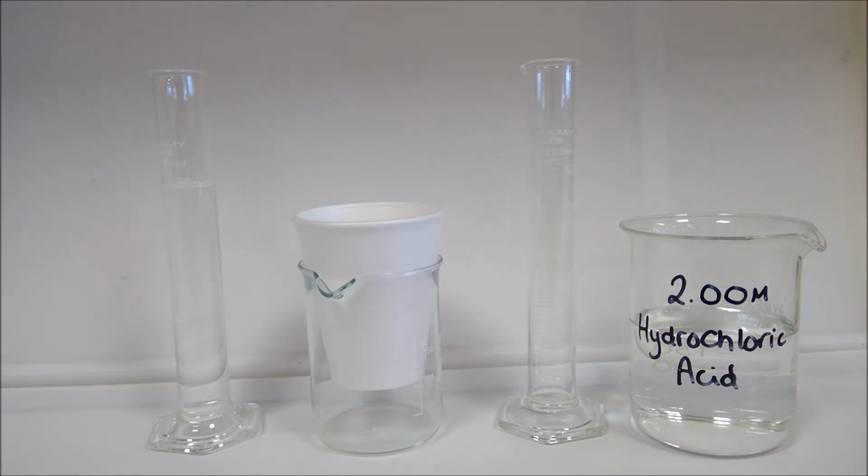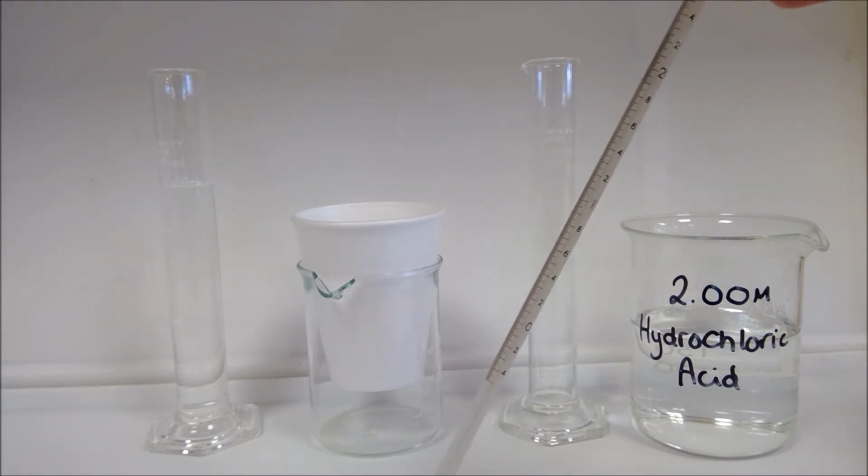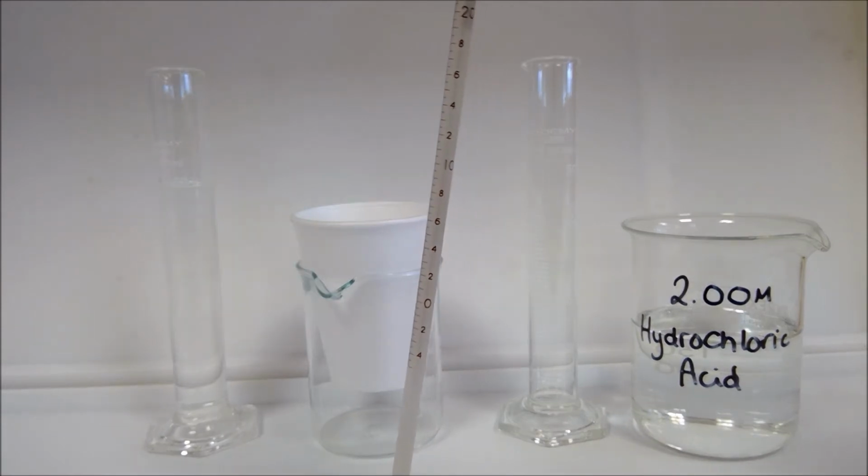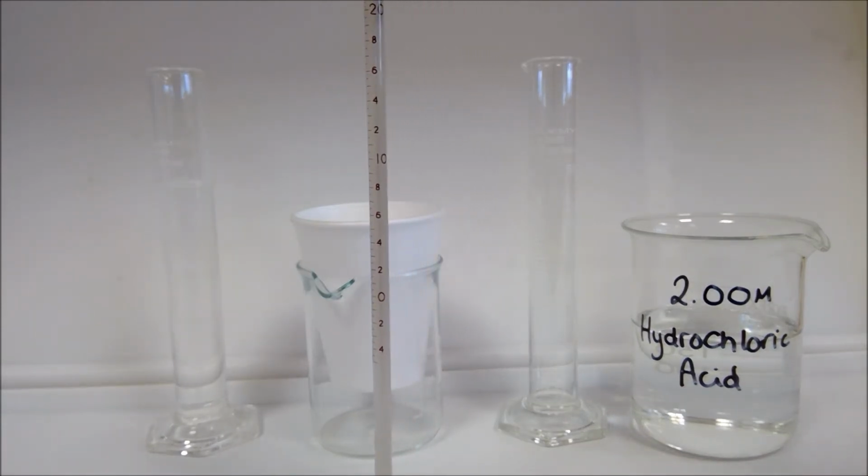So here we're looking at measuring enthalpies of reaction, specifically enthalpies of neutralisation today. Rather than use the data logger method that we used last time, where we were looking at producing a cooling curve, we're going to do a slightly more straightforward method in that we're just going to be using our thermometer to look for the highest, or in another scenario, lowest temperature reached during the reaction.